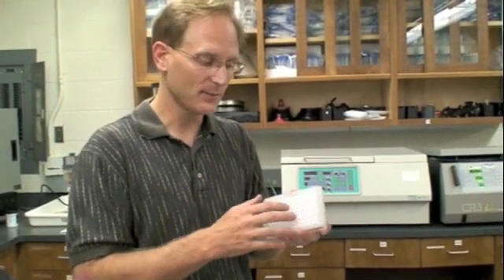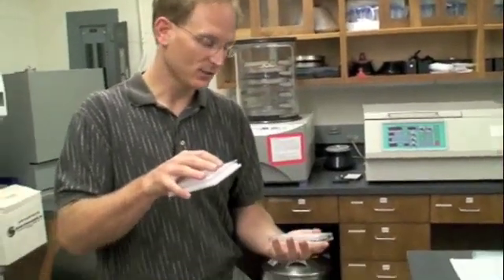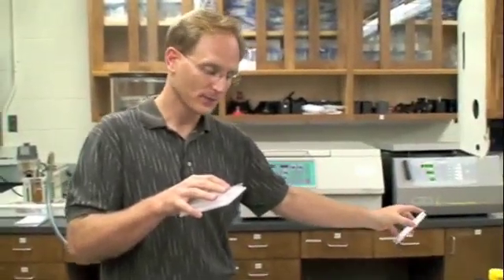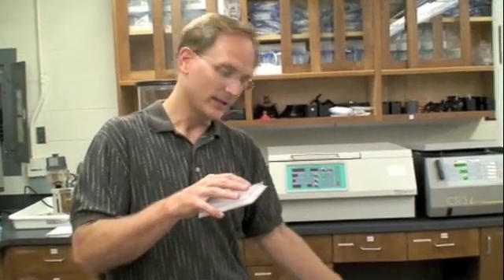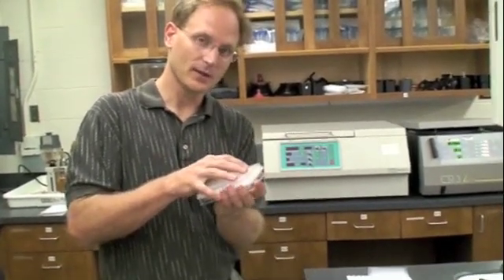The second time we spin... the first time we spin, we get rid of all the excess water we added to hydrate the Sephadex. The second time we spin, then we'll have our column prepared. We'll have a bunch of water in this plate. We separate the two, take them out of the centrifuge, dump out the water, or even get a new tray that's clean, and put a brand new plate like this underneath.